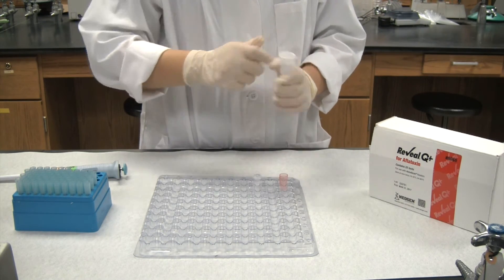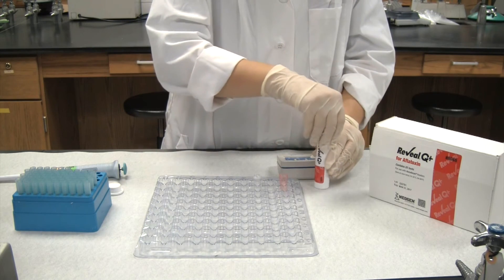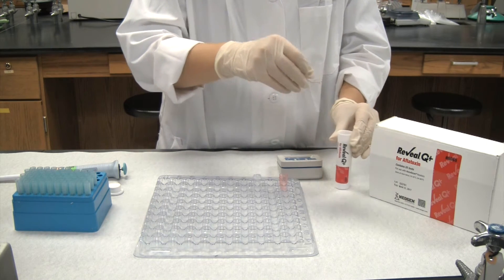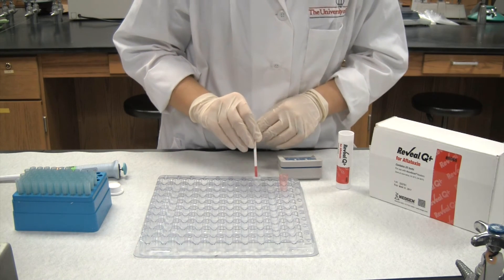Next, place the test strip into the cuvette. There is an arrow on the strip indicating the direction in which the strip should be inserted into the test solution. Leave the strip in the cuvette for 5 minutes.